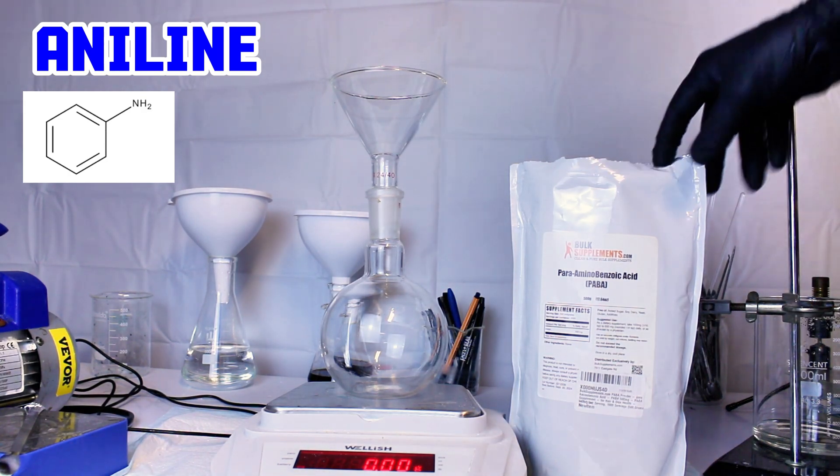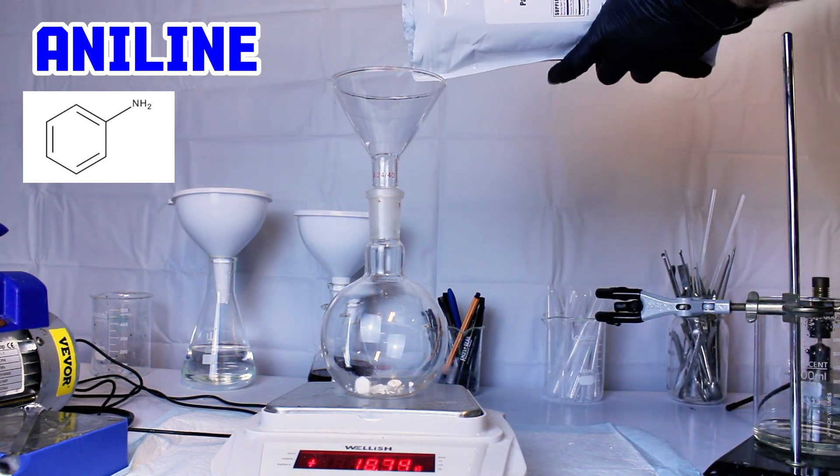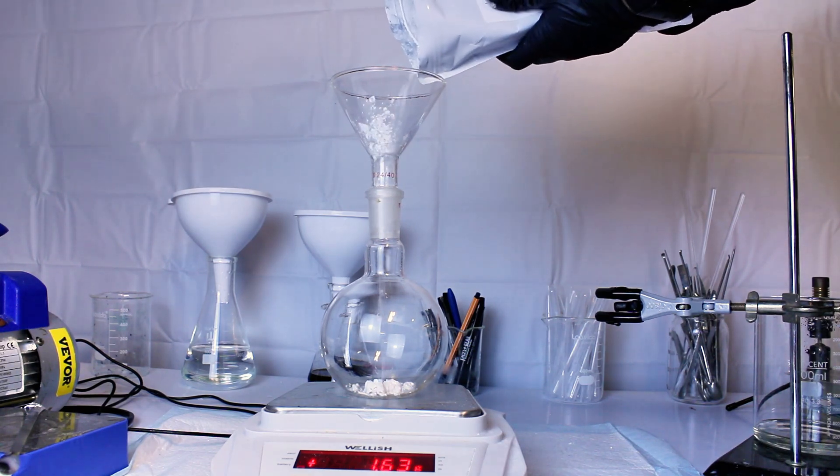Today I'm going to make the chemical aniline, which is the simplest aromatic amine and an extremely important industrial chemical.